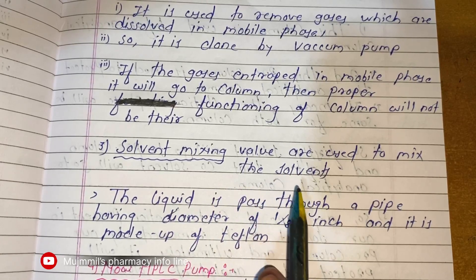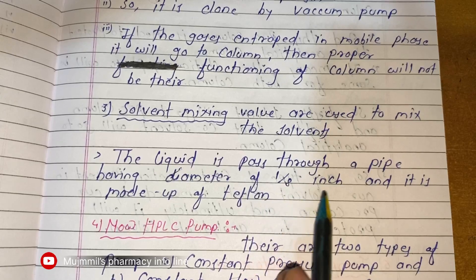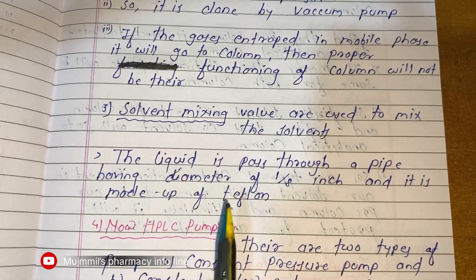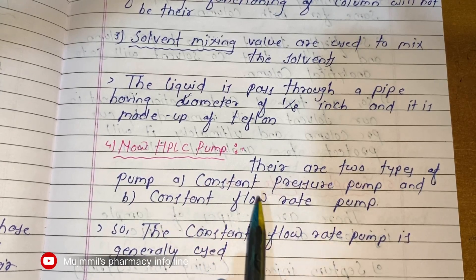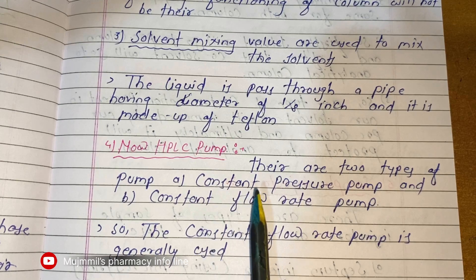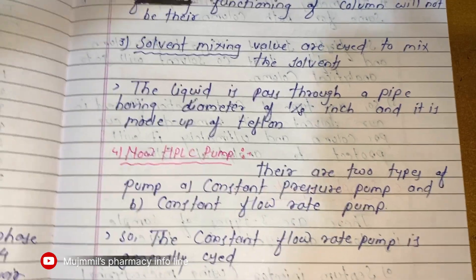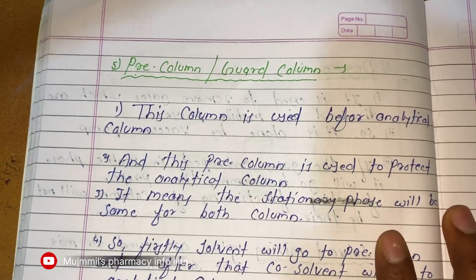The solvent mixing vessel is mainly used to mix the solvents. The liquid is passed through a pipe with a diameter of 1/8 inch, made of Teflon, through which the solvent passes. Regarding the HPLC pump, there are two types: a constant pressure pump and a constant flow rate pump. Generally, the constant flow rate pump is used in HPLC.